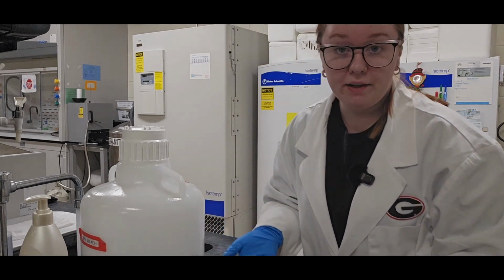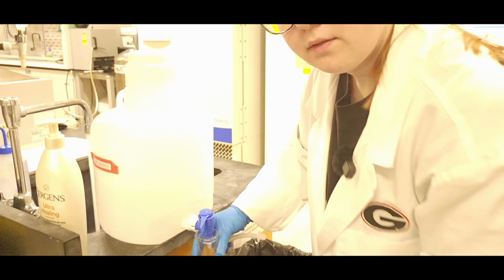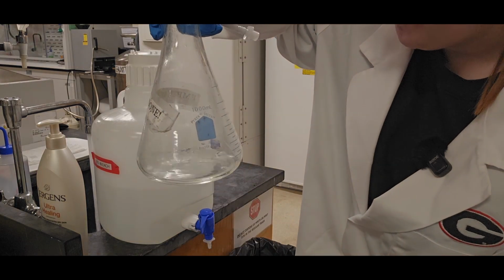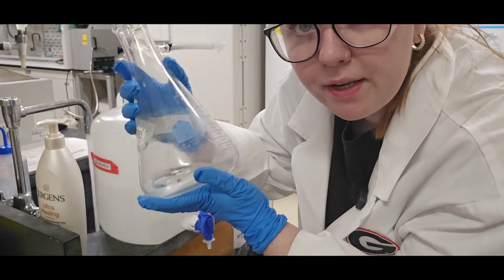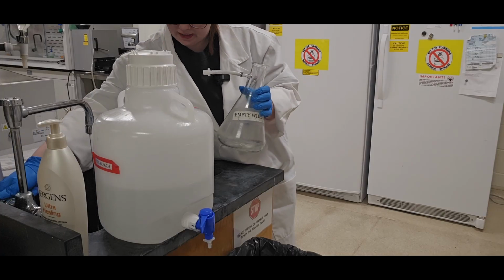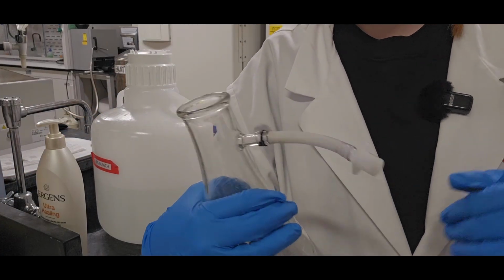And I leave the water running while I refill it with bleach located here. Enough to restore what was at the bottom. This is important to decontaminate any aspirate you might have from your work. And I come over here and turn off the sink, and now I'm going to re-plug this back up.